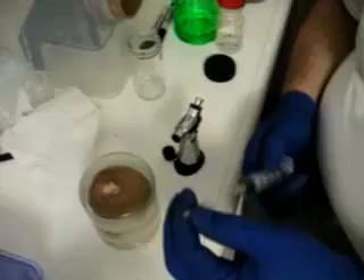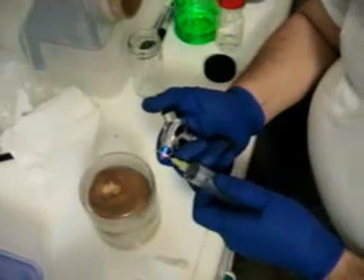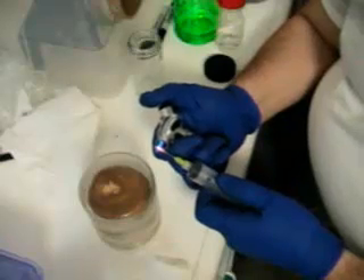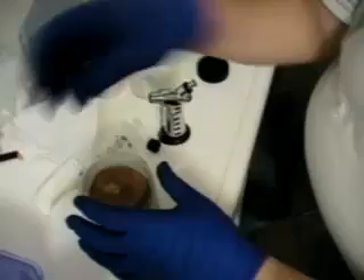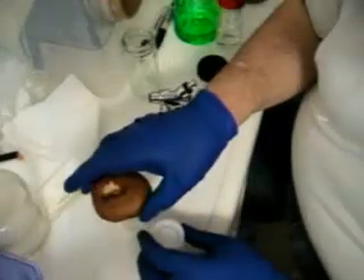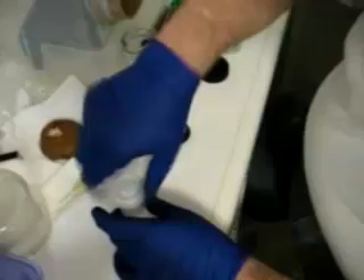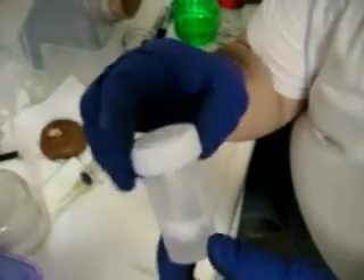So we've got our syringe and I'm going to flame sterilize the needle because this is going to go right into the solution. I like to cool off the needle with rubbing alcohol — I keep it in small bottles rather than larger ones. Take the jar off here. So here's the lid — I'm going to take the cap off and put the lid on real quick. As you can see, that water is nice and cloudy, which means it's full of spores.